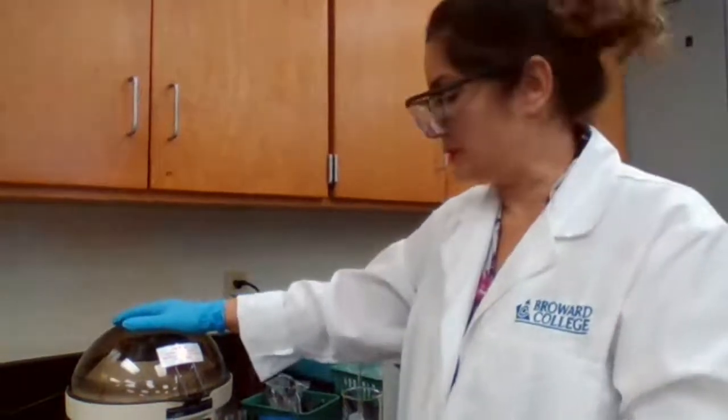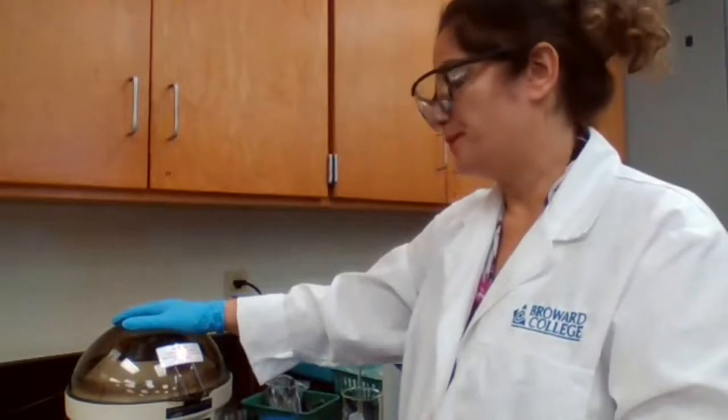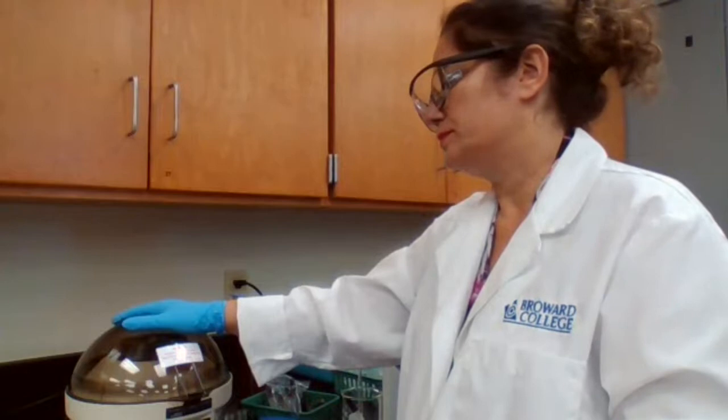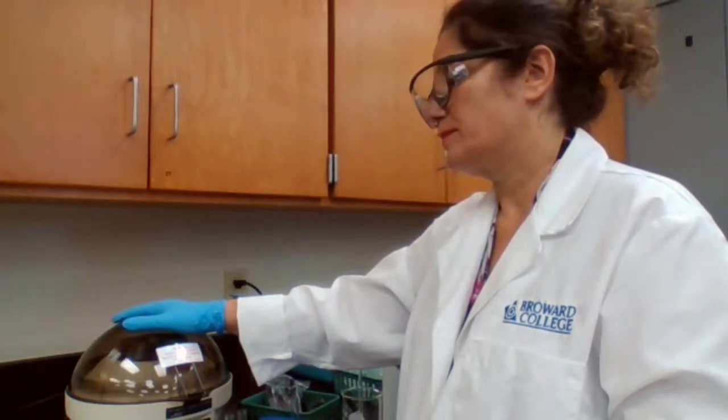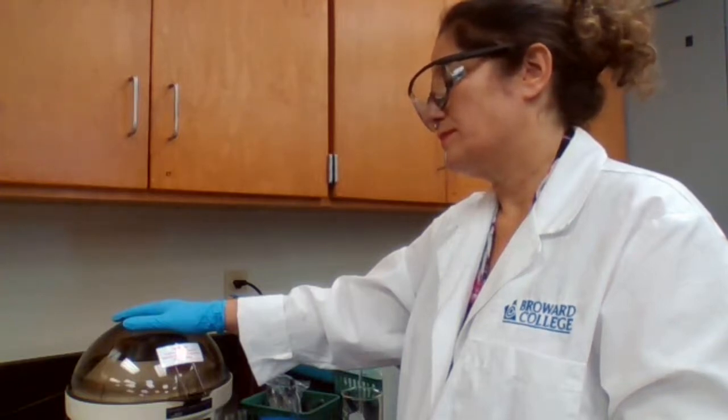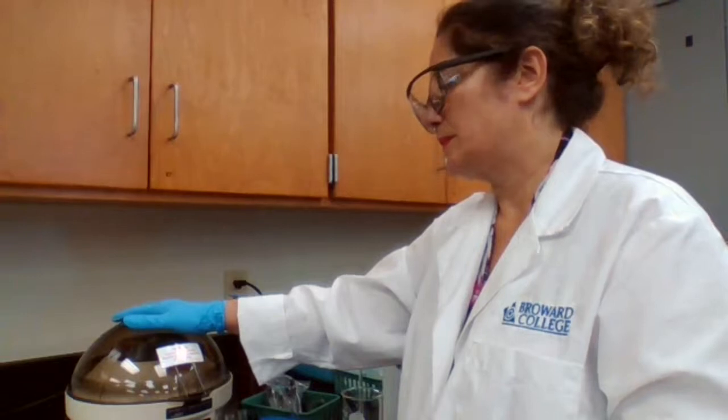"30-second centrifuge should be sufficient." Okay.